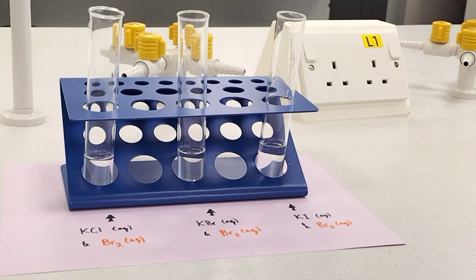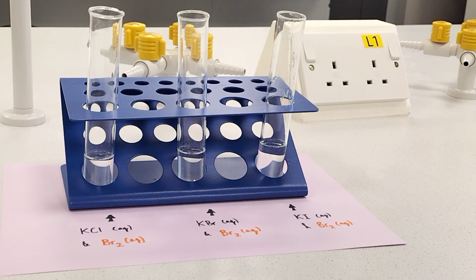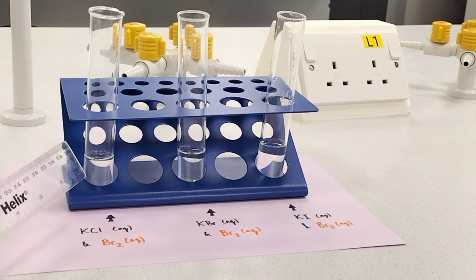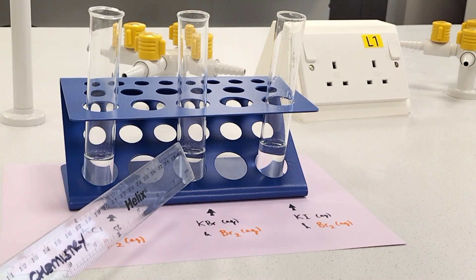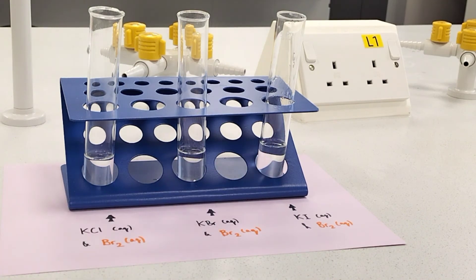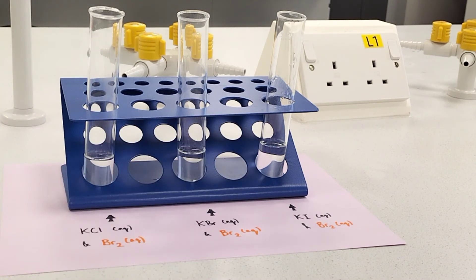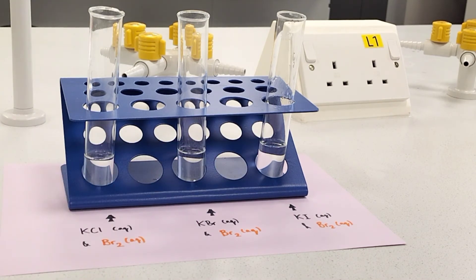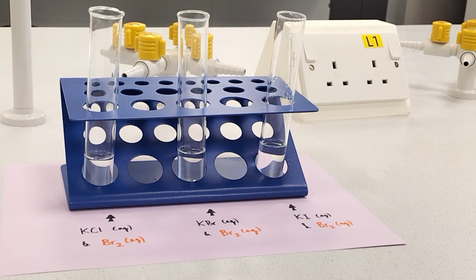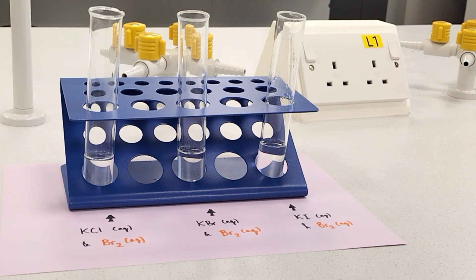Now I'm going to investigate dilute bromine water interacting with the three solutions. So we have boiling tubes of potassium chloride, a colourless solution containing chloride ions; potassium bromide, containing bromide ions; and potassium iodide, containing iodide ions. I'm going to add orange bromine water to each, looking for a colour change indicative of a displacement reaction, which will help me understand the reactivity of bromine compared to chlorine and iodine.